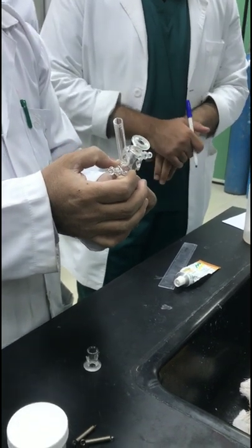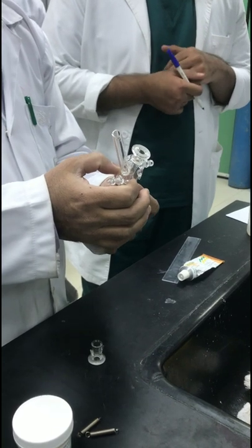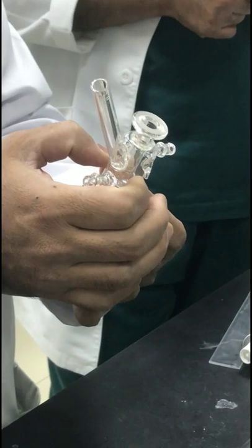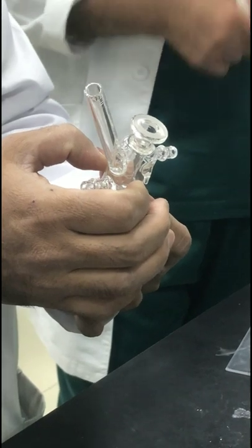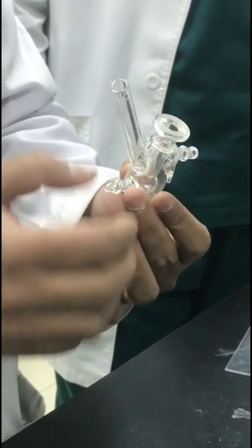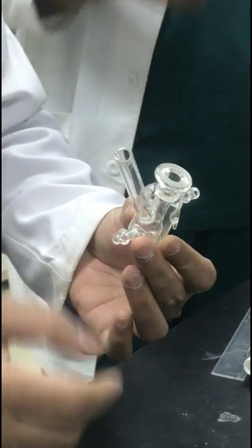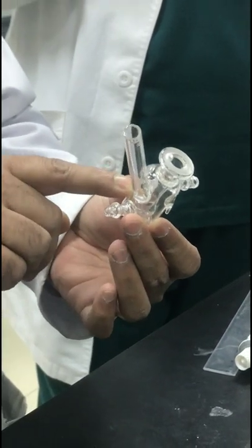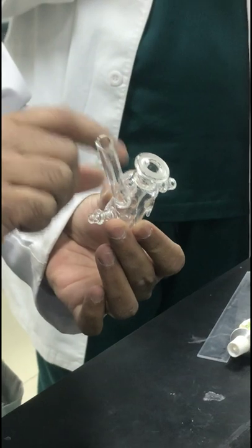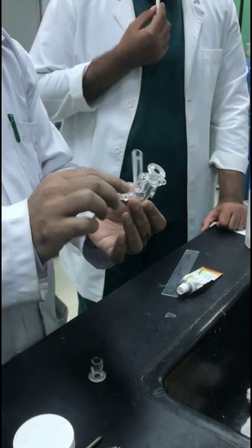In the receiver compartment there is an inner receiver cell. It comes in different sizes, so you have to measure the size or volume of the receiver compartment, which will be taken into consideration in calculations. Before starting the experiment, you have to fill it and see how much volume it holds.